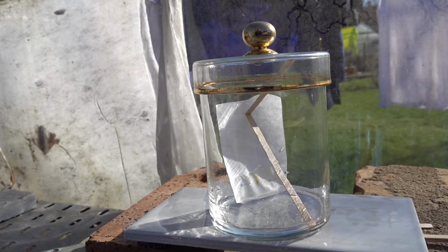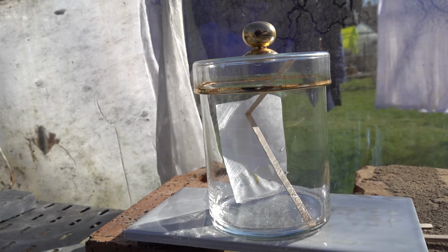And when you carry out chromatography, you should let the solvent run most of the way up the chromatogram, in this case the paper. So we're looking for the solvent to run about 1 centimetre from the top of the paper. I haven't got a perfect run this time, and the solvent's not quite level because the chromatography tank isn't quite level there.